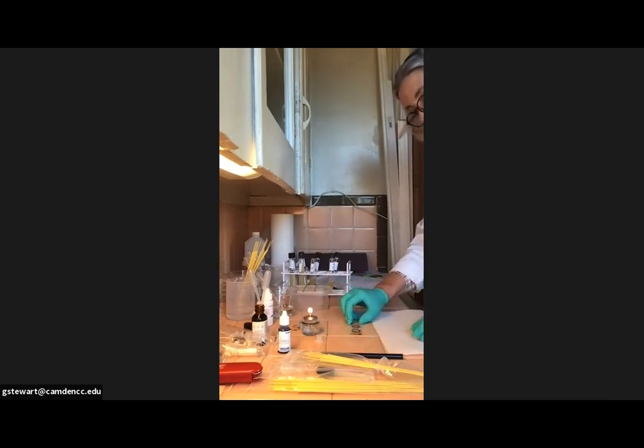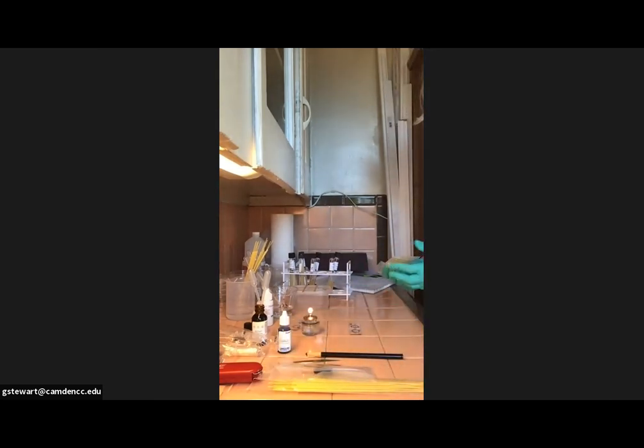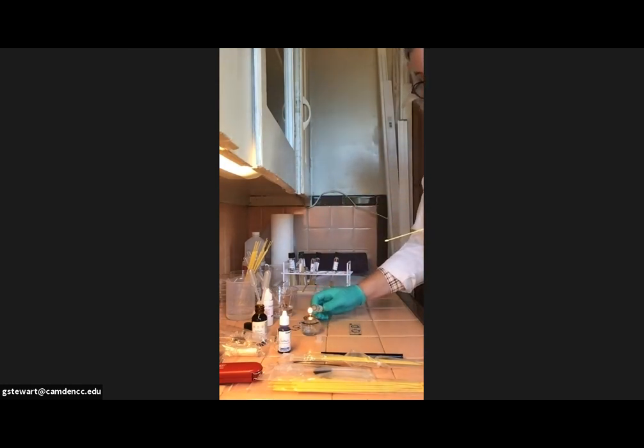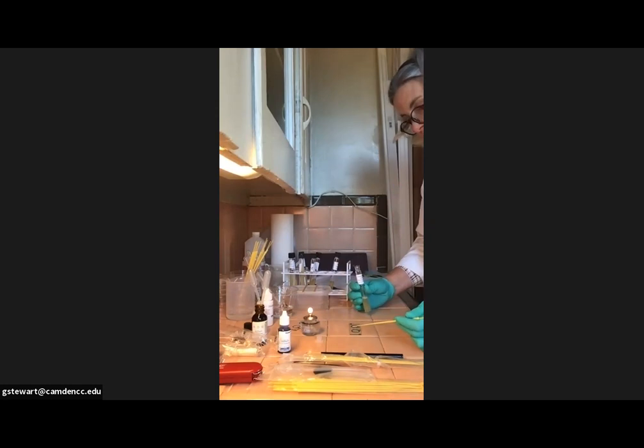I'm going to move slide number 2 off of my paper towel here and get the bacteria on slide number 2. So that is going to be in letter A circle, the Serratia. So I'm going to tighten that cap, give it a little shake. Ooh, there's a lot in there because this is day 2 for the growth of the Serratia. I'm going to flame the top of the tube here. Reach in, grab some bacteria, and mix those around in circle A.